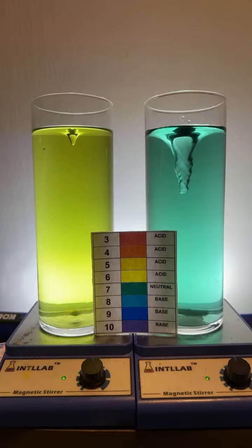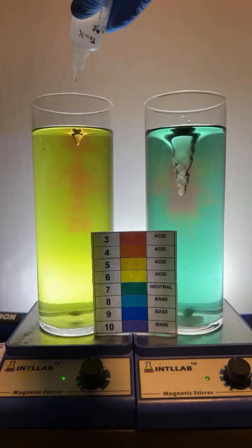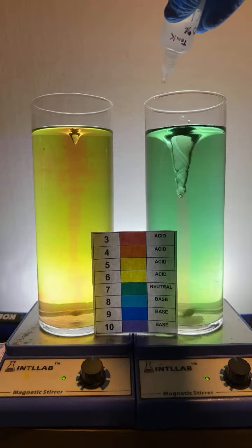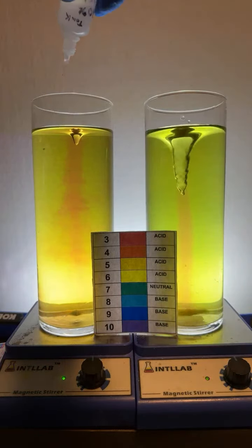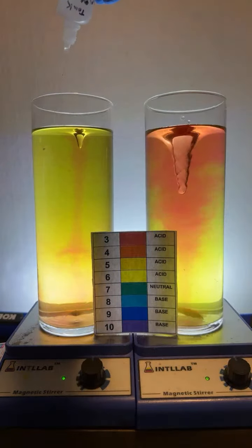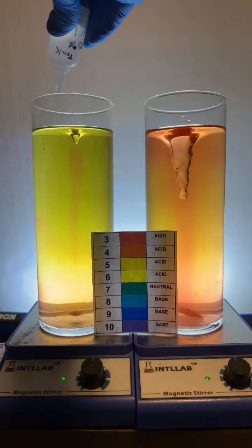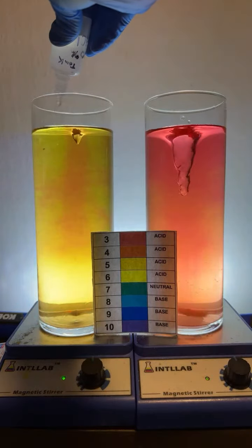Make them both crimson red. All right, you got it. We'll try to make them crimson red here. Here we go. I'm not making liquid lime. I'm making sodium chloride as I react the acid and base together.